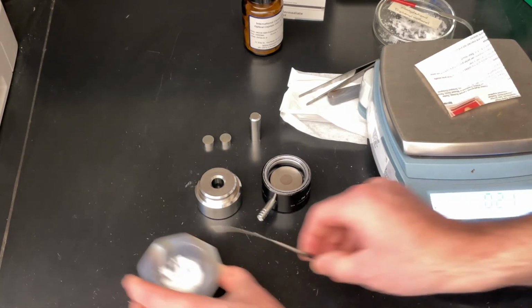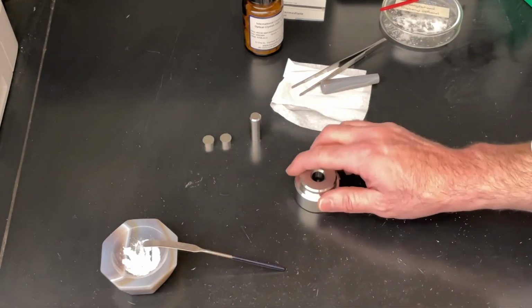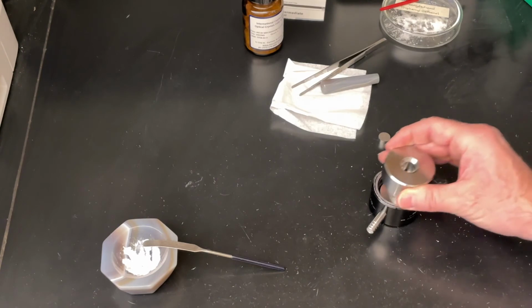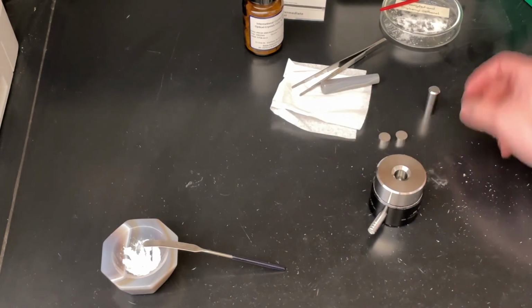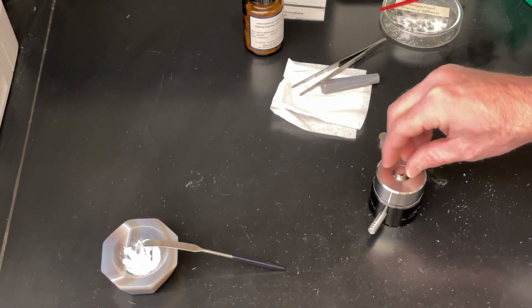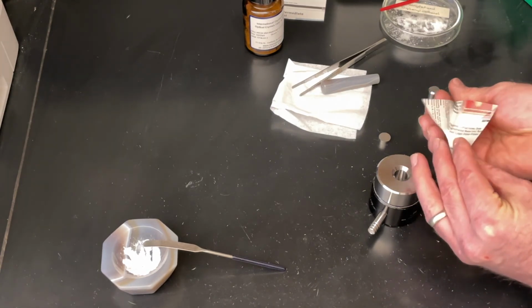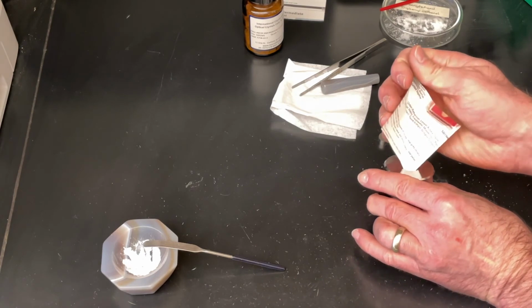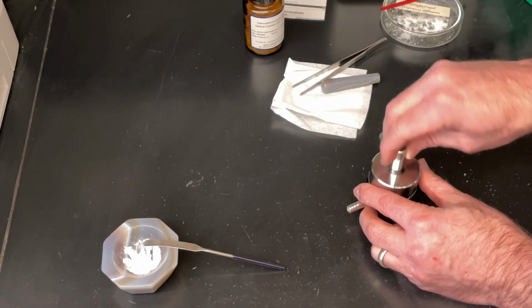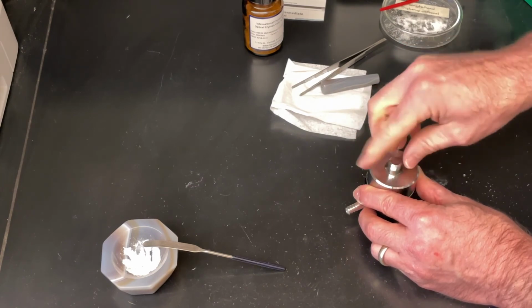Okay, from there, we're going to press that into a pellet. So the way that we press it into a pellet is we use this die set. The die set is designed, this is the body, we take the body, we snap the body together. Once the body is snapped together, we take one of the anvils, we put the anvil inside. With the anvil inside, we take our powder and put our powder on top of the anvil. We flatten that powder out using a piece that's called a ram. We put it in and twist it to smooth the powder out and flatten it out.